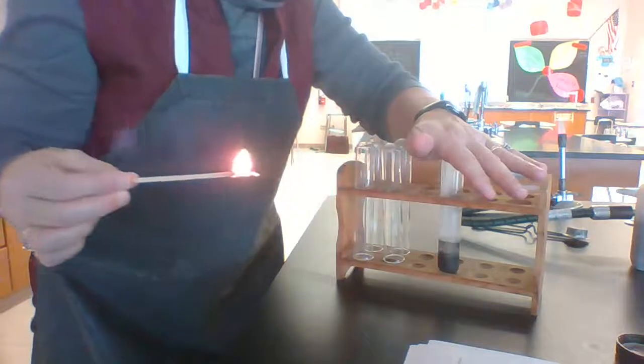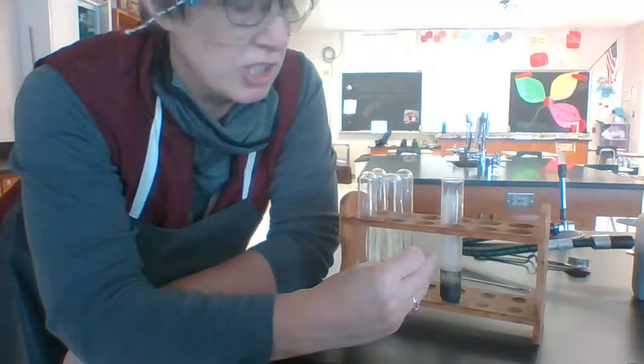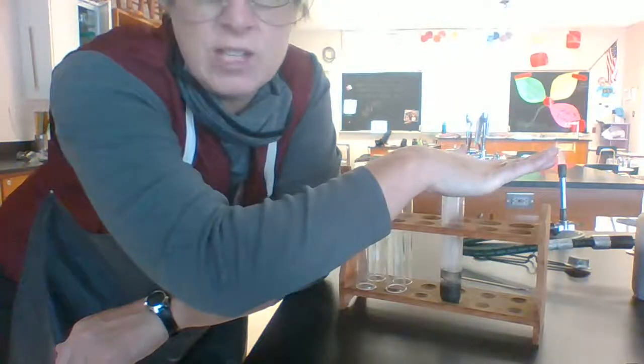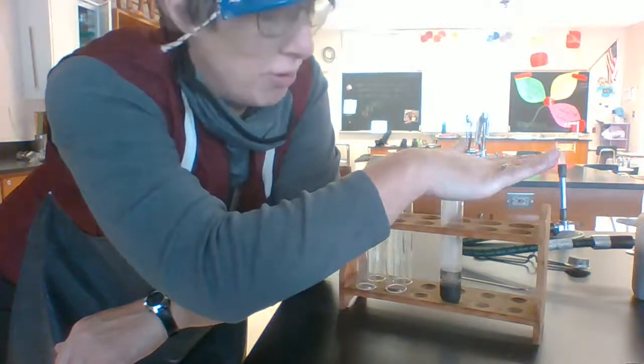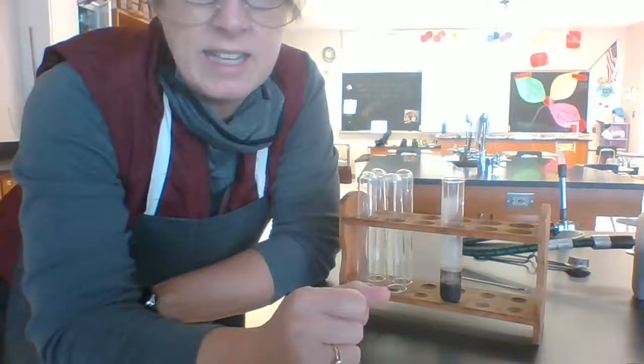but what's happening there is the hydrogen peroxide decomposed, produced oxygen gas. I sped it up using the catalyst, manganese dioxide, and I put a lid on it to trap the oxygen gas, and I proved that oxygen was present using that glowing splint that reignited in the presence of oxygen. So that is reaction E.